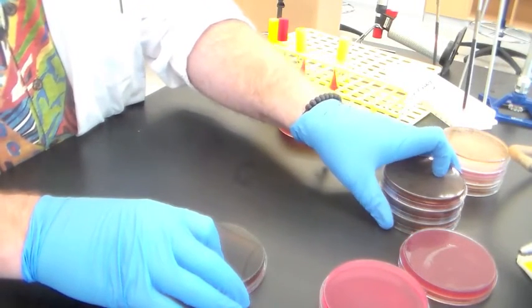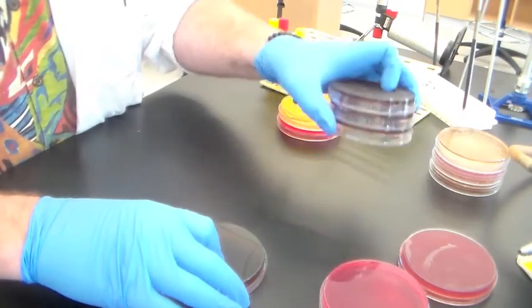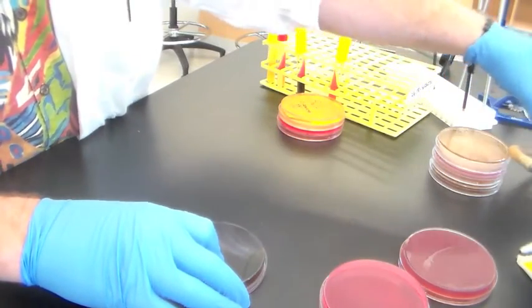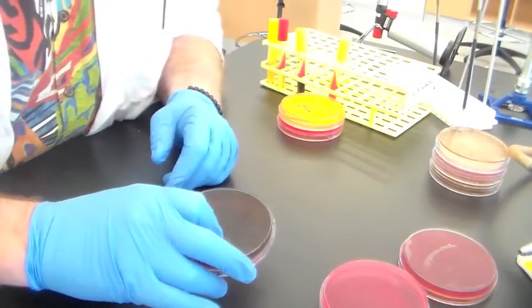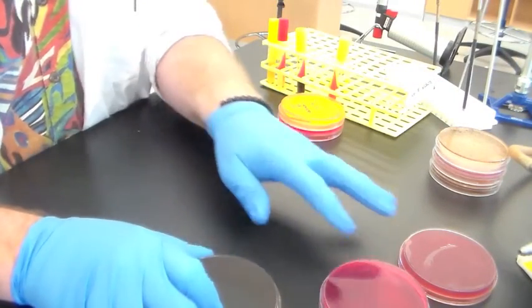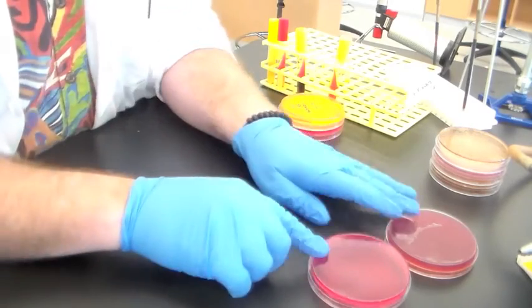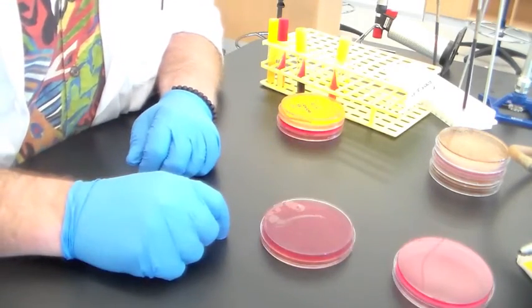One of the important things to remember for lab practicals and for your unknowns is that eosin-methylene blue agar is both differential and selective. It grows gram-negatives and differentiates them based on whether they can ferment lactose or not.